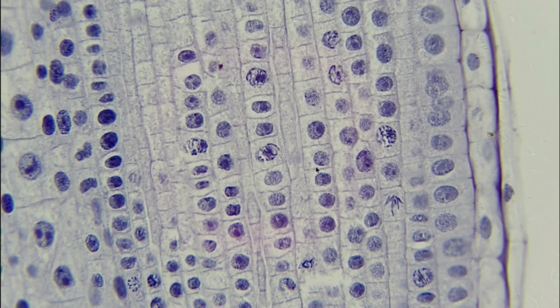So what we're looking at right here, we have a few different stages, and it's always important that when you're looking into the microscope, trying to find the pointer in the microscope, because whether I am pointing to this cell here or this cell here, those two are in different stages of mitosis, and so it's very important to make sure you're looking at the right cell when trying to answer those questions.